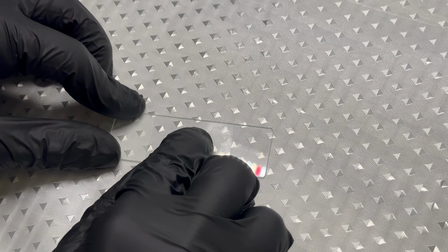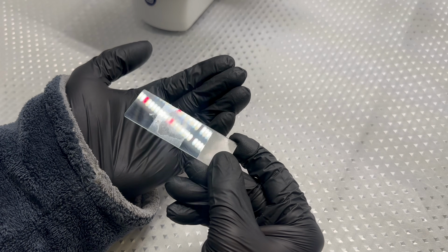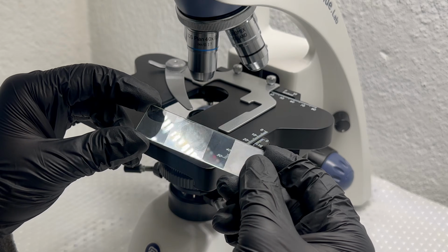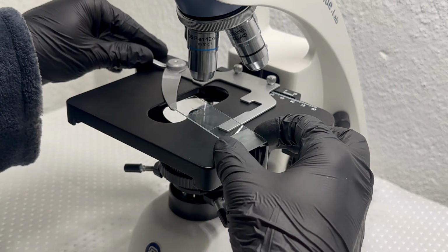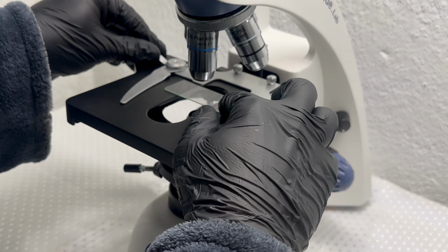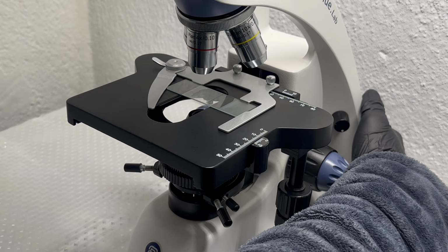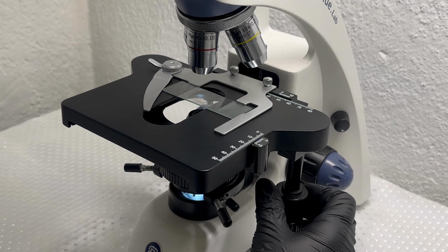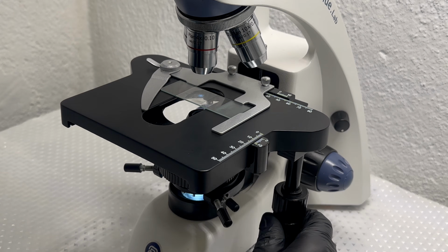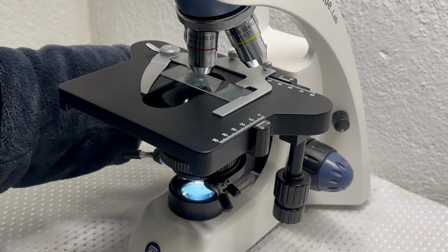In this video, I take an ordinary piece of avocado, the same kind people eat every day, and examine it under a microscope. I begin by showing the avocado as we normally see it, before preparing a very small sample. The sample is tiny, almost invisible to the naked eye, yet it contains the full internal structure of the avocado. Once placed on a microscope slide and carefully prepared for observation, this small fragment becomes a window into a hidden world.